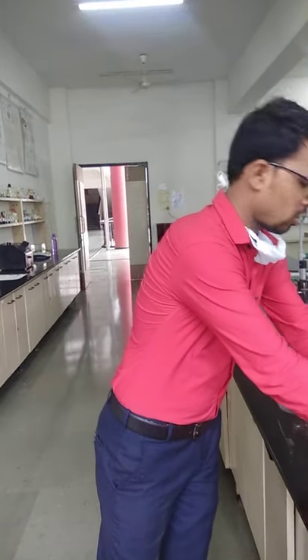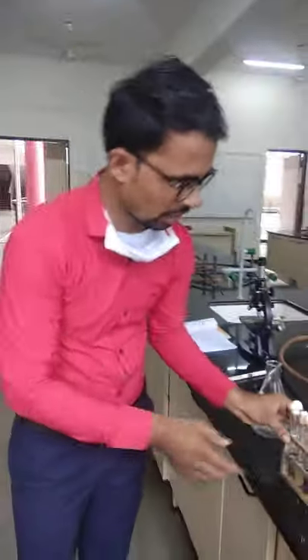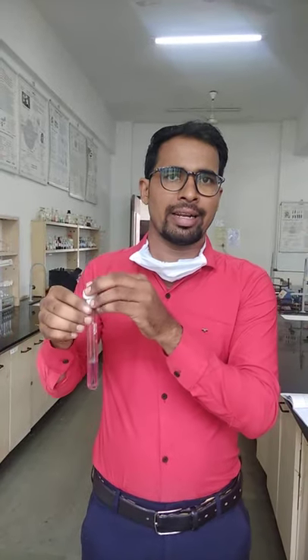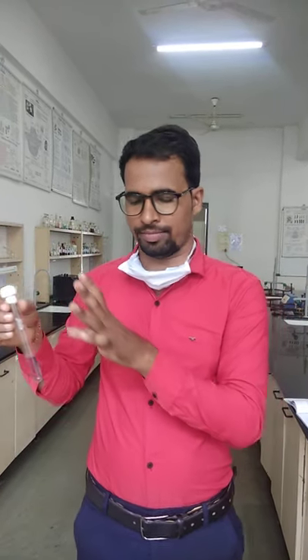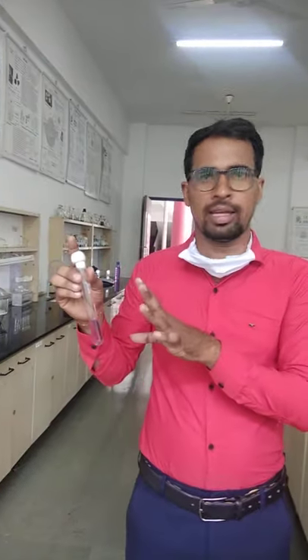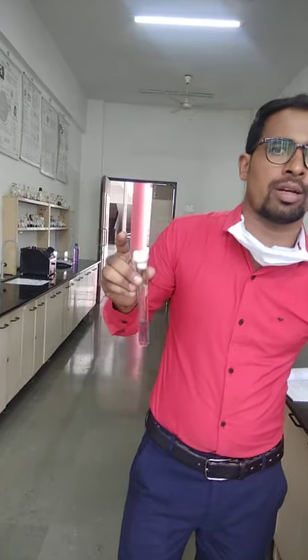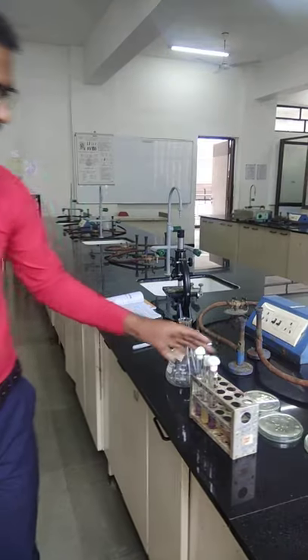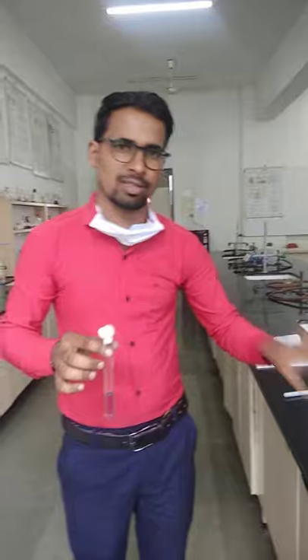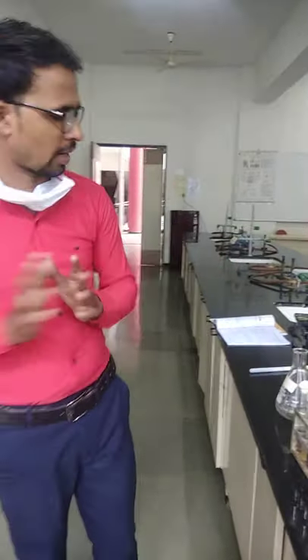Let's move on to the next instrument. After that we have a test tube. We need the test tube for the storage of the culture and this culture media we are going to use for transfer into a particular petri dish. You also need the test tube stand, which is another apparatus generally used in our daily practicals.